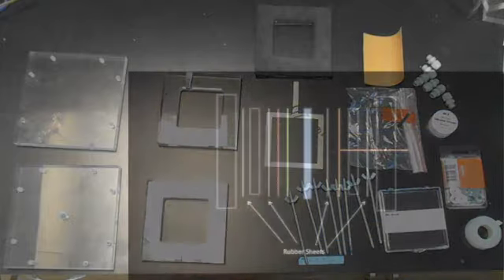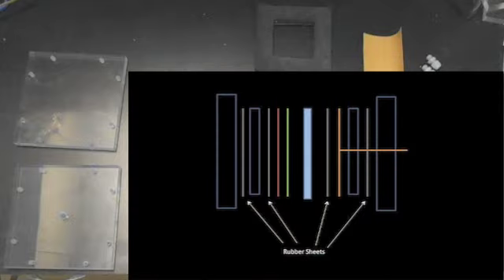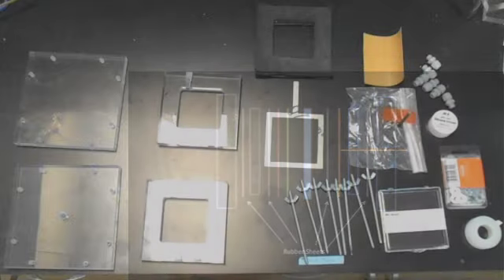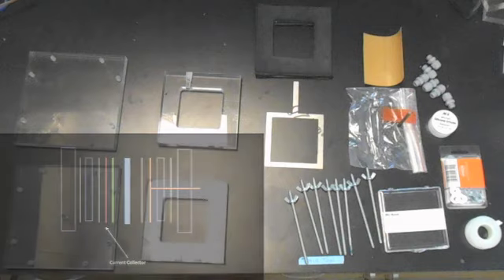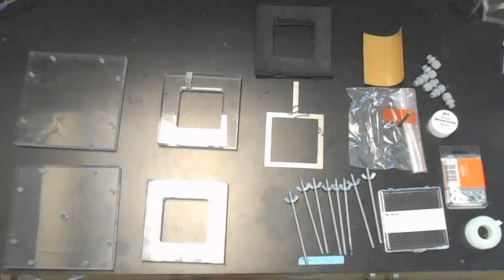At the top of the screen, we have four rubbers that were cut to the same size as our acrylic interior frames. Below, we have a stainless steel current collector cut to the dimensions of our interior half cell. Next, we have our 8 threaded rods with wing nuts already screwed into them.